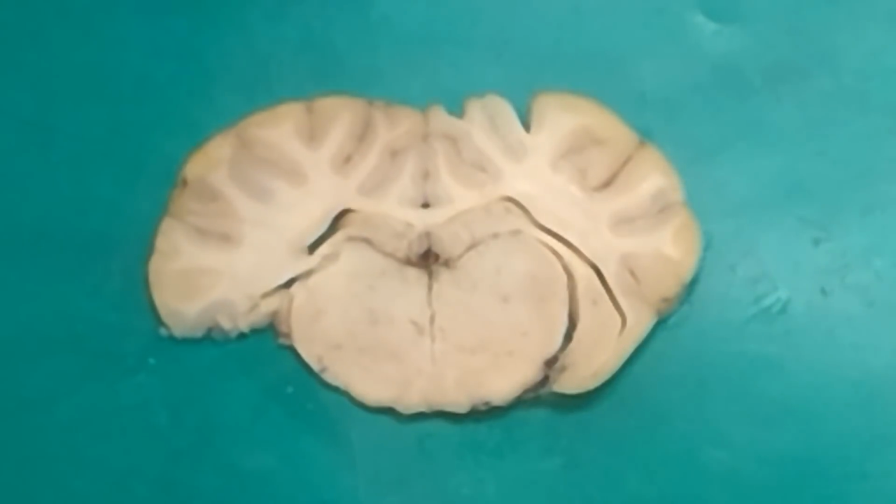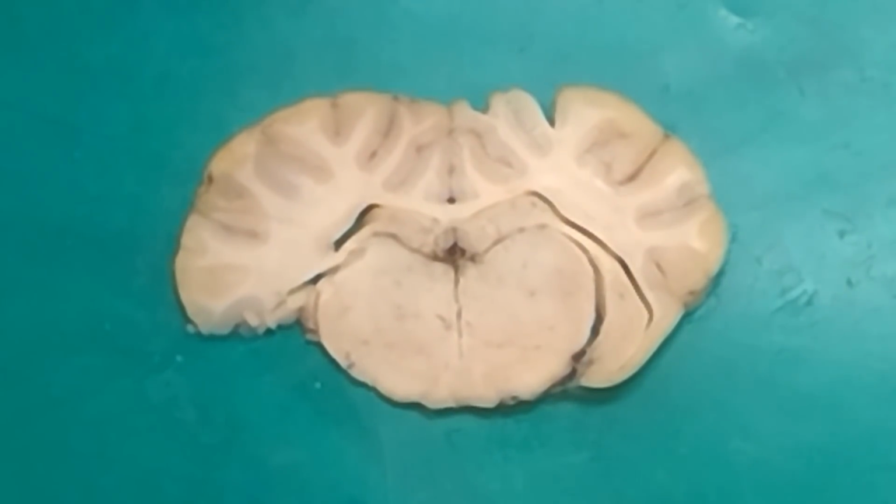And so the thalamus would just be below the third ventricle, that area. The third ventricle kind of goes around the thalamus. So it's that narrow space that's between where it has a top portion and a bottom portion. It's kind of just a narrow space right there. Okay.